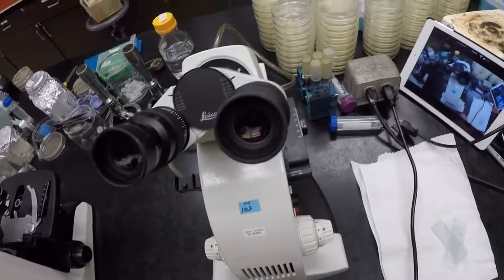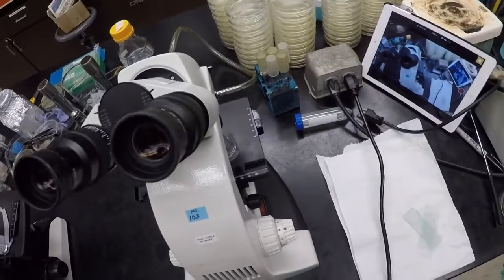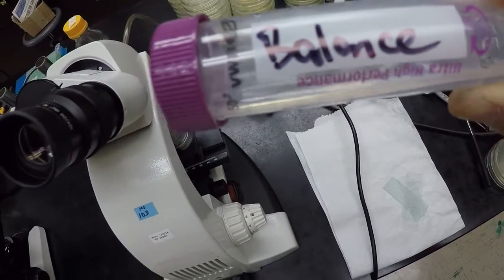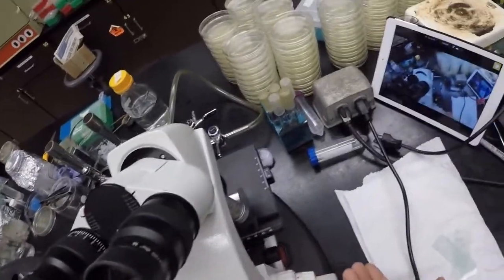And in order to use the microscope, we want to now put it into start position. Essentially the way we want to focus on things is the way our eyes work. We bring our sample as close as we possibly can to our eyes. And then we slowly move it away until it becomes focused. Is that focused? Focused enough, right? So that's how we do this. So now we bring it up to start position.